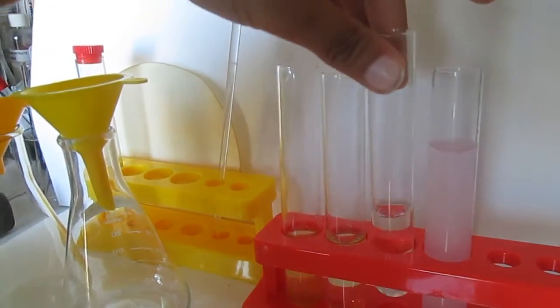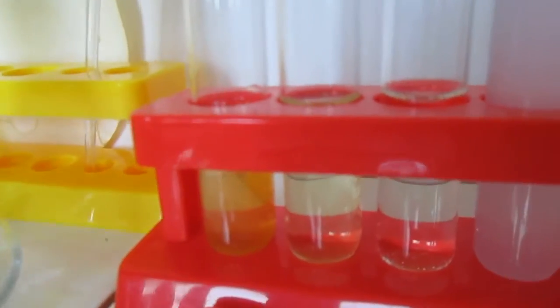In this third test tube I made a solution of citric acid. It is a clear color solution.